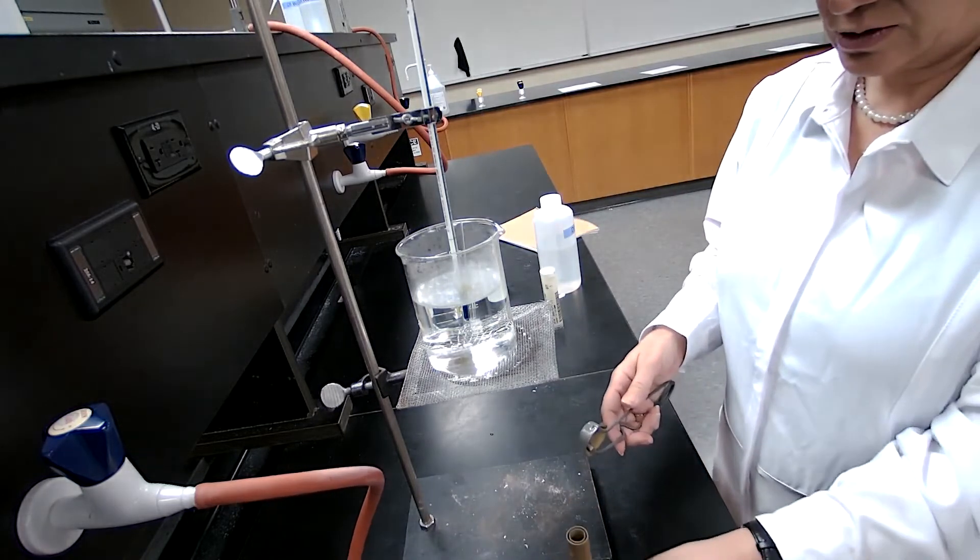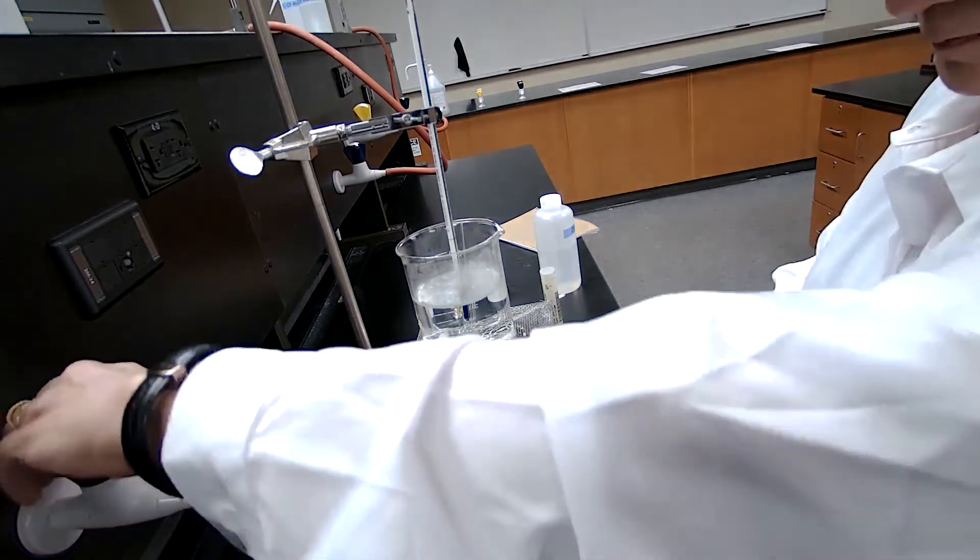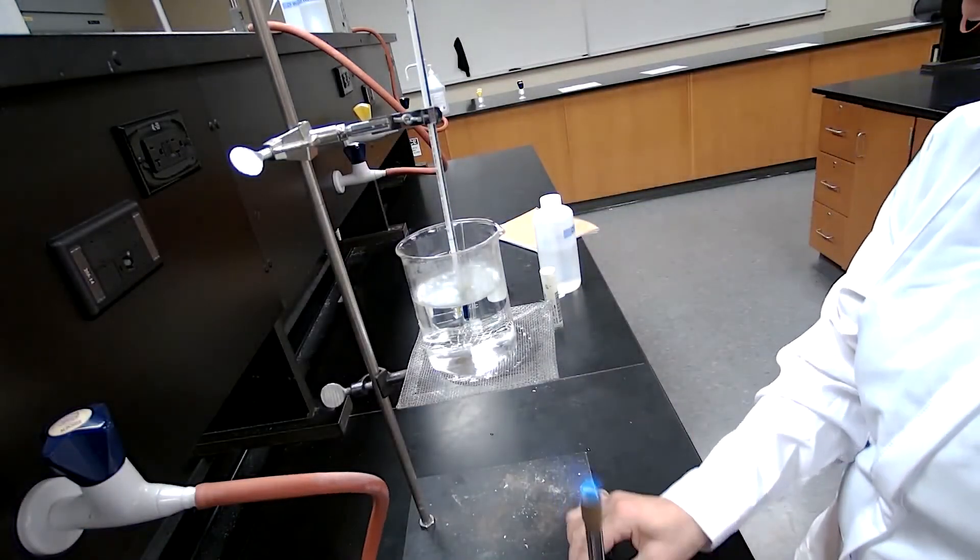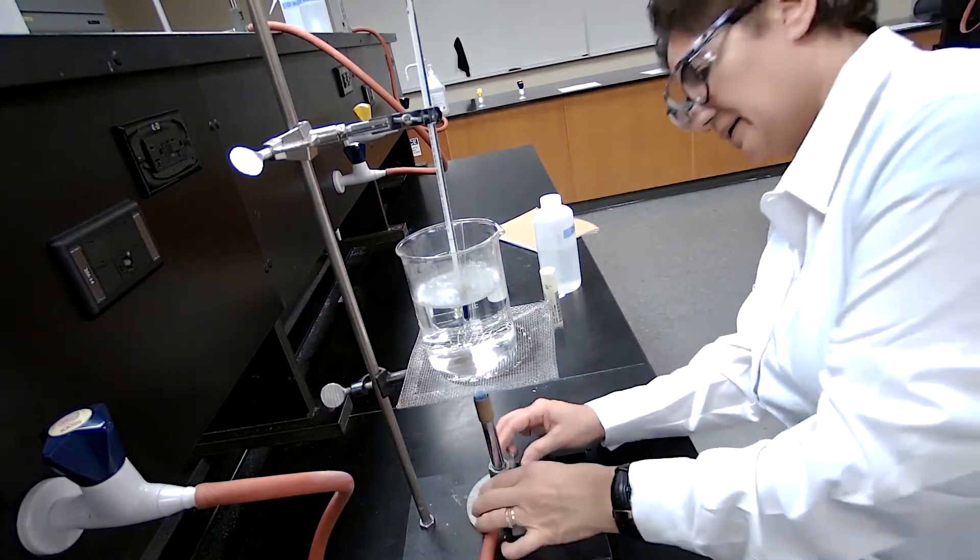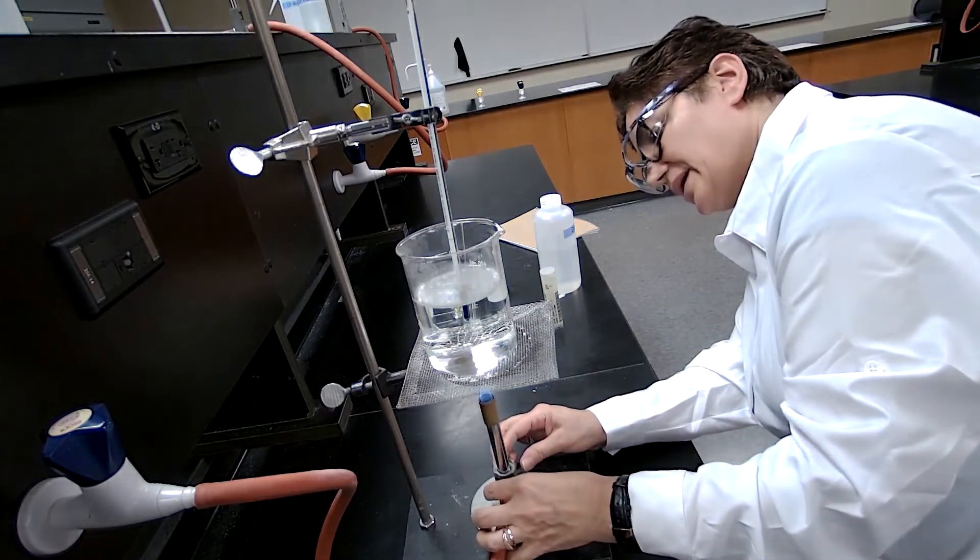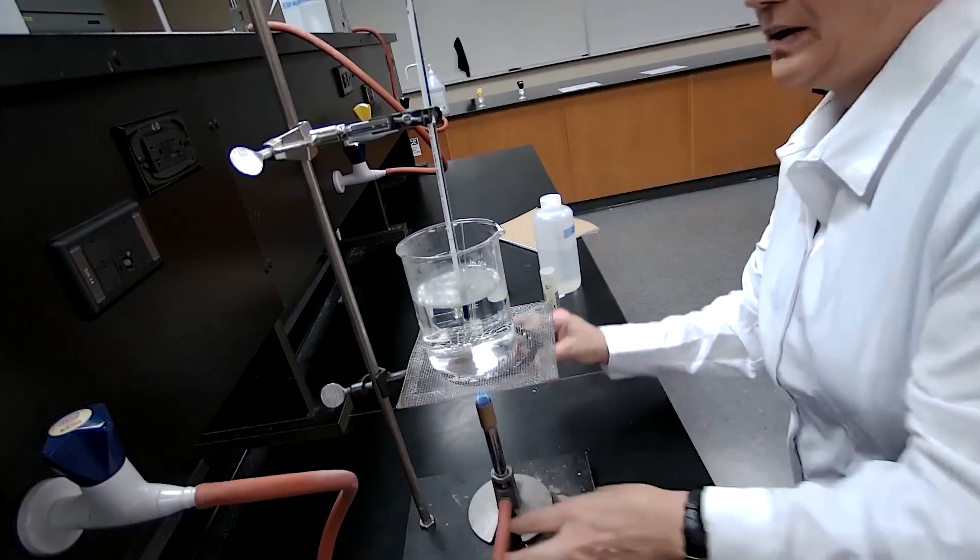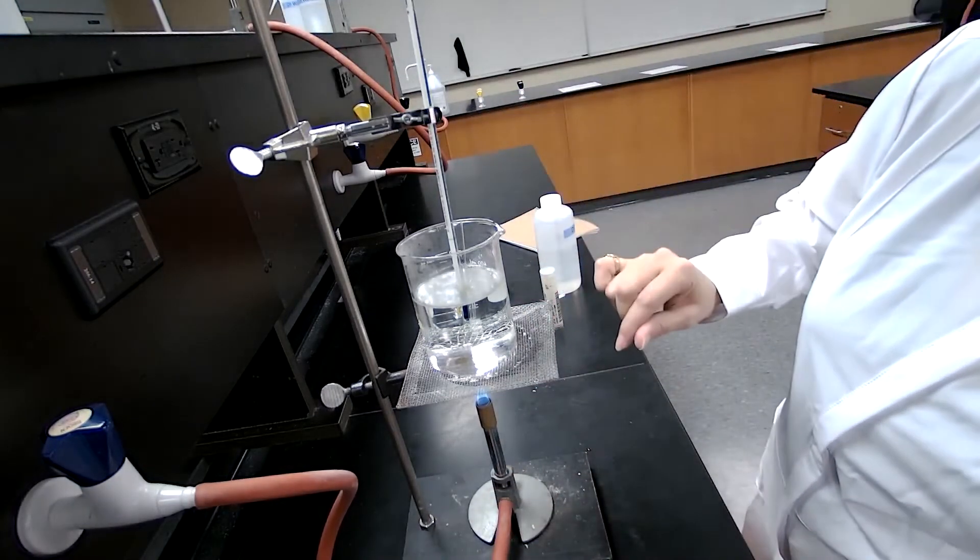So I'm going to turn on the Bunsen burner, place the Bunsen burner underneath and wait until I see the bubbles again. And this is for the unknown.